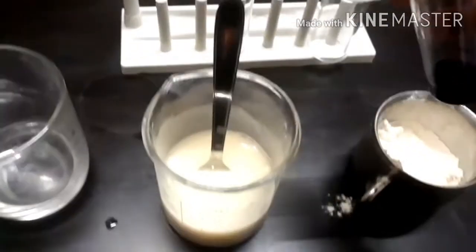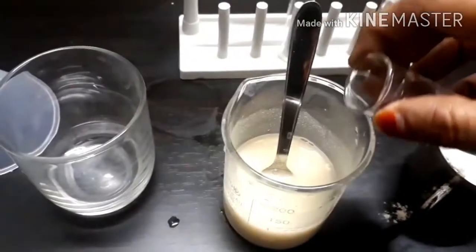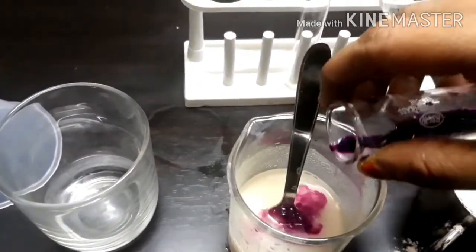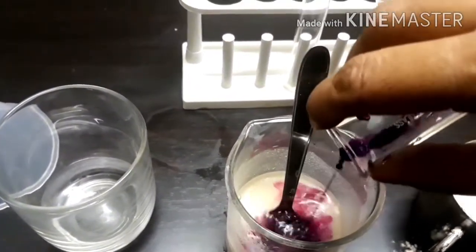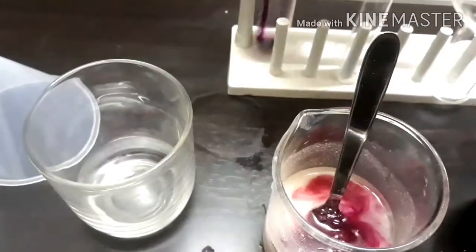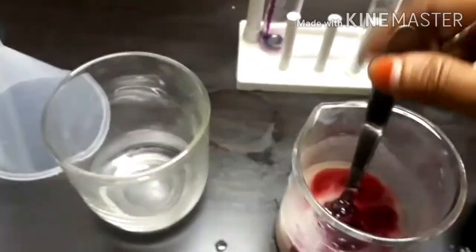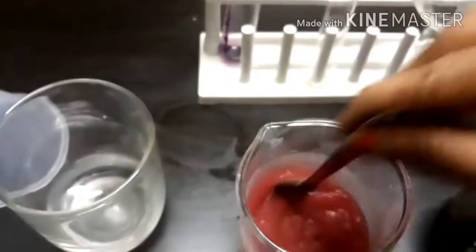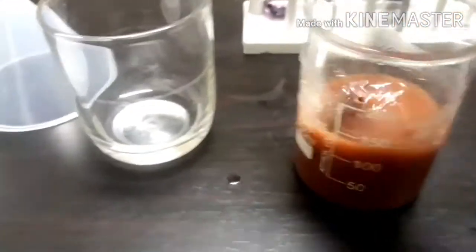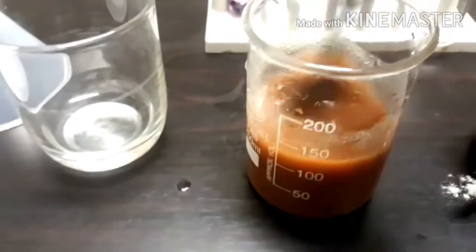To this, add a drop of iodine solution — here we are using potassium permanganate solution — to the wheat flour solution, and observe that the color has changed to brown.